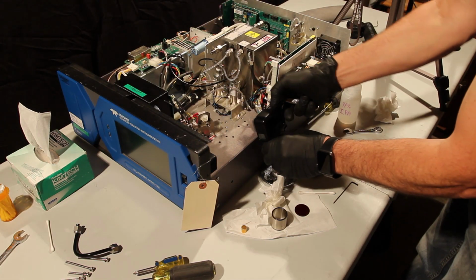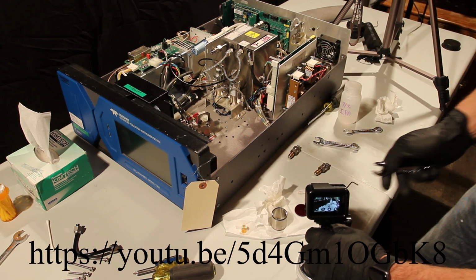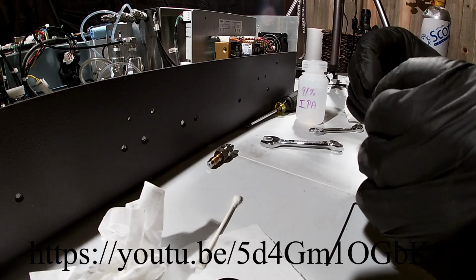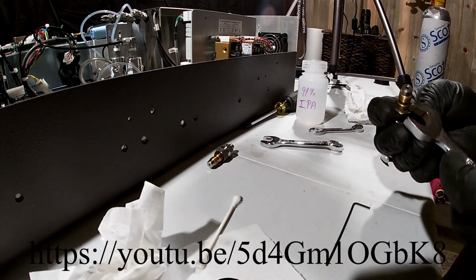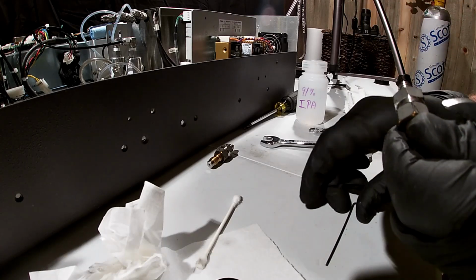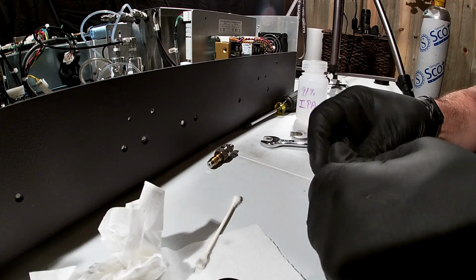These are overly tight, really. They don't need to be that tight. There we go. Just make sure you use wrenches that are the right size and that are backed up. We've got another video on our YouTube site that shows the way that these come apart and go back together. But for this video, I'm going to do it again. That other video is really nice. It's got some sort of jiffy action going on there. But if we put two wrenches on here, we can split this apart and not lose any pieces.